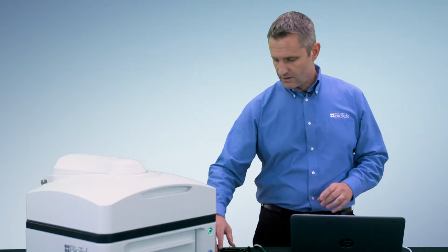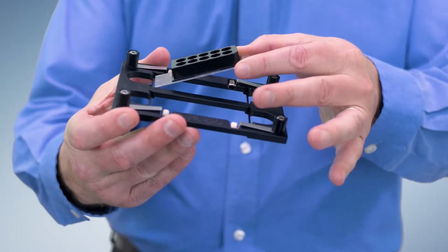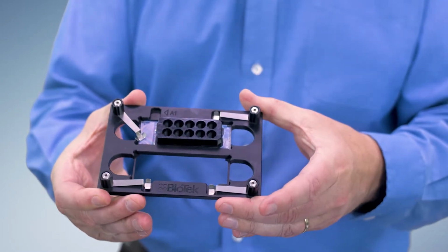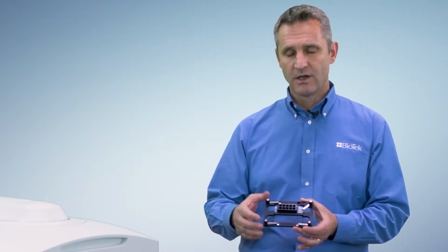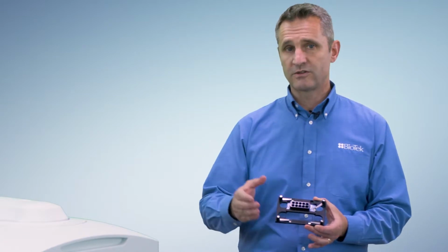On the other hand, if you use a chamber slide on the instruments, you're going to put it in a slide adapter, like I'm showing you right here. You could put another one of those on that slide adapter, and when you have two slides like this, you lose that regular pattern that you have on the microplate. And this is where the concept of labware in the software interface comes in.